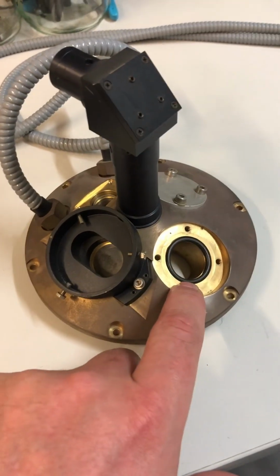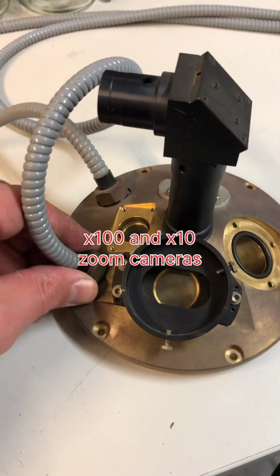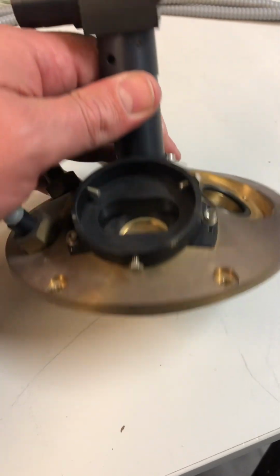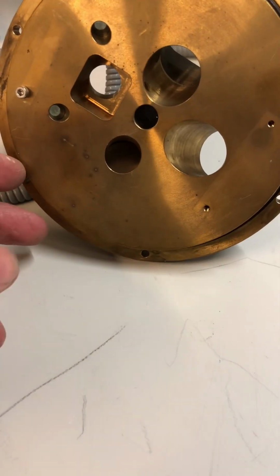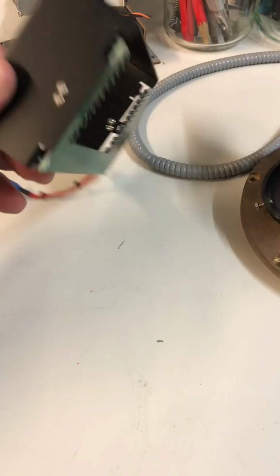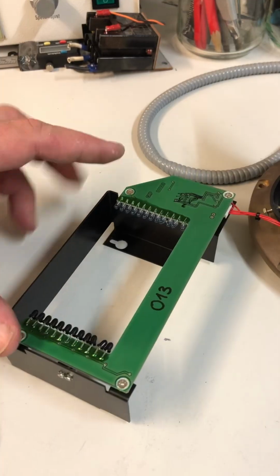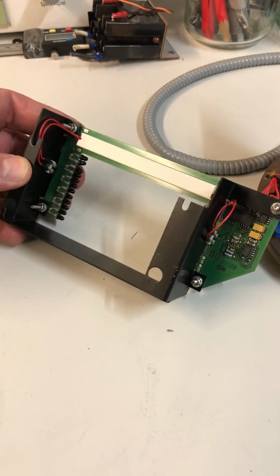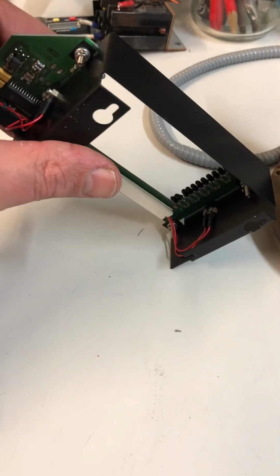What we have in the vacuum chamber head module. Here was the detector, here was one camera, here was another camera, optical fibers, and I think here was the X-ray tube. But what I cannot explain is the window. X-rays would not go very nicely through the window. So that's a puzzle. Here we have a lens. On the inside was such an assembly. It is LEDs and near-infrared photodiodes, and the board was doubled with mechanical switches. I think this is for sample positioning.